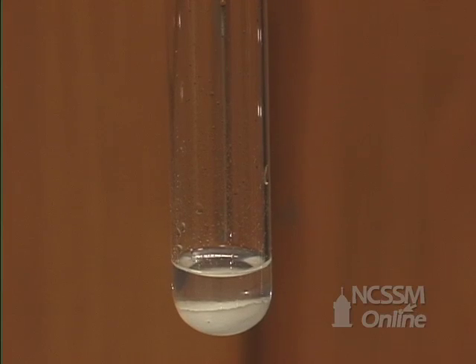The sulfurous acid is not stable and decomposes to form water and sulfur dioxide. The sulfur dioxide escapes from the solution.